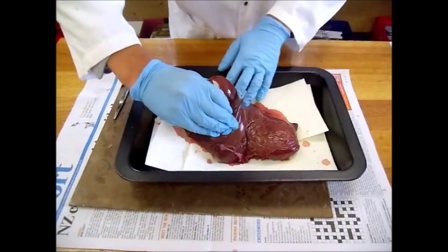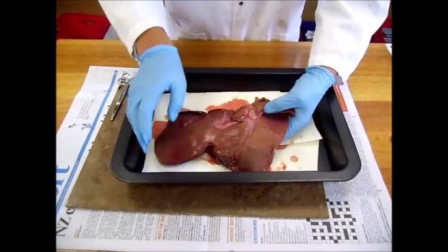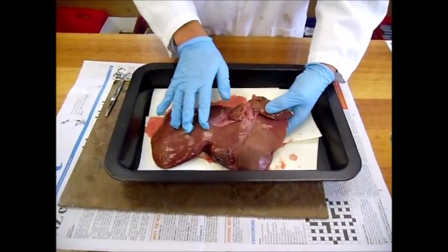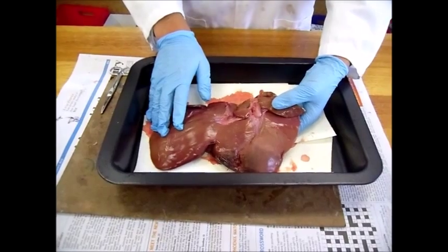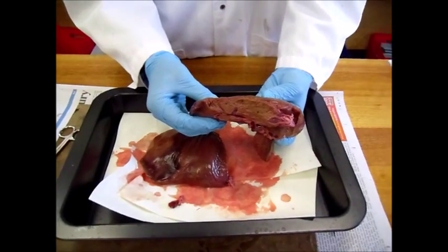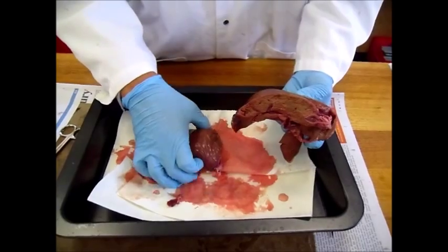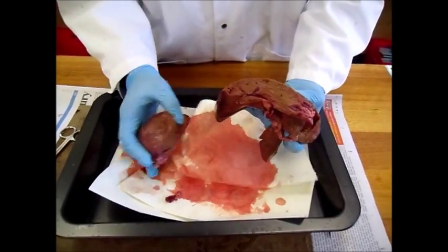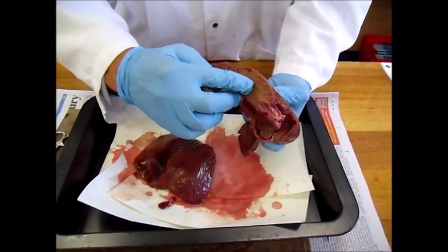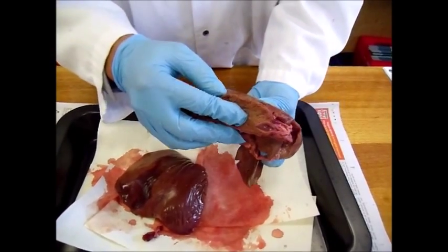After food has been digested in the small intestine, the nutrients are absorbed and transported to the liver via the hepatic portal vein. I've cut the liver into two halves and as you can see the interior is brown, soft and sort of like a sponge.